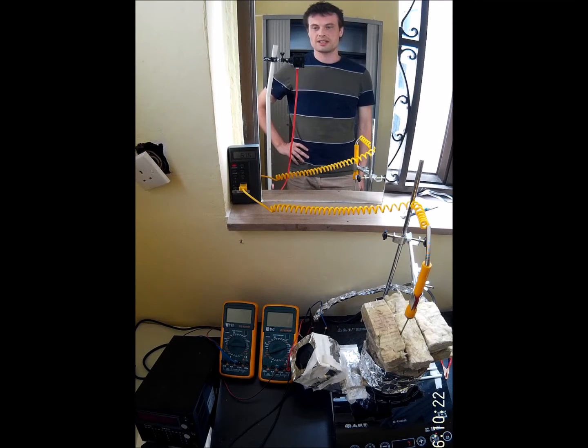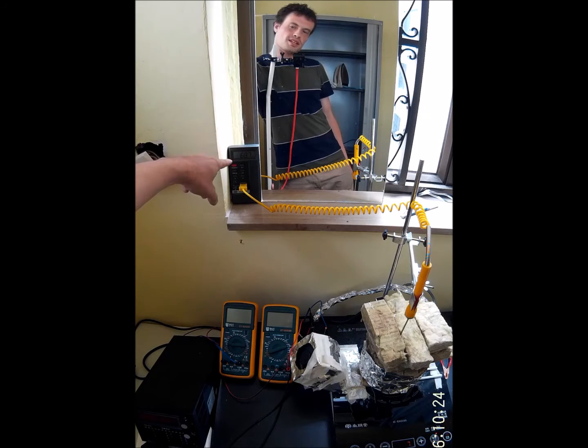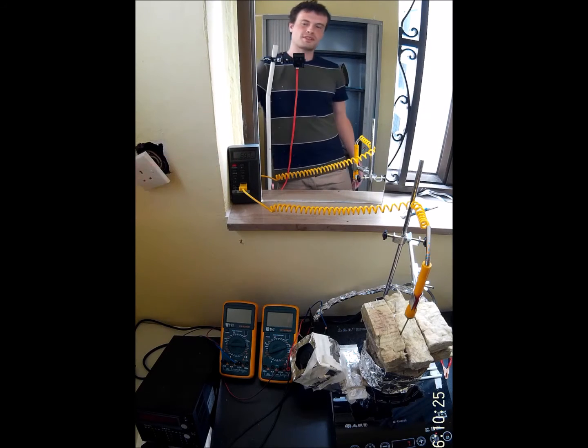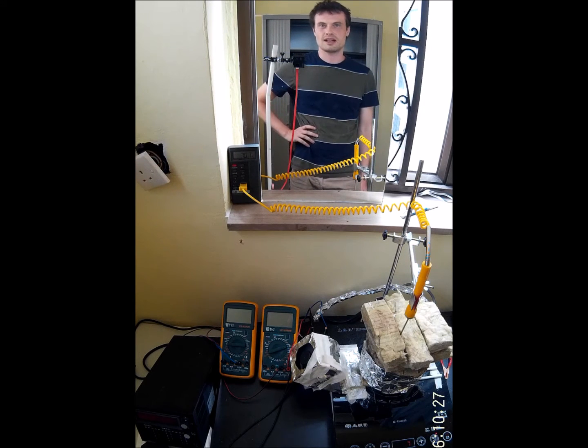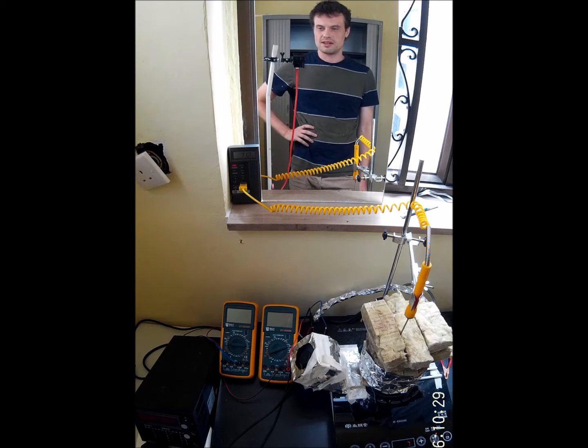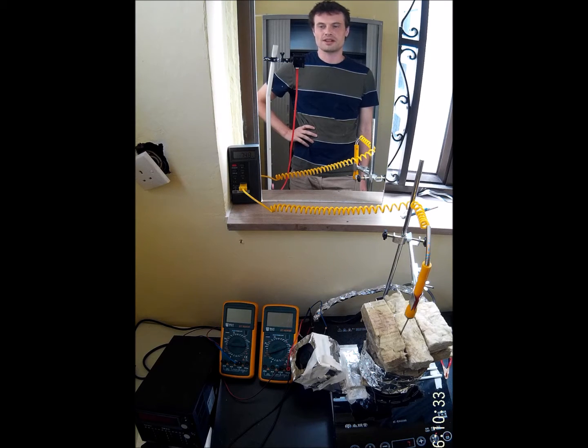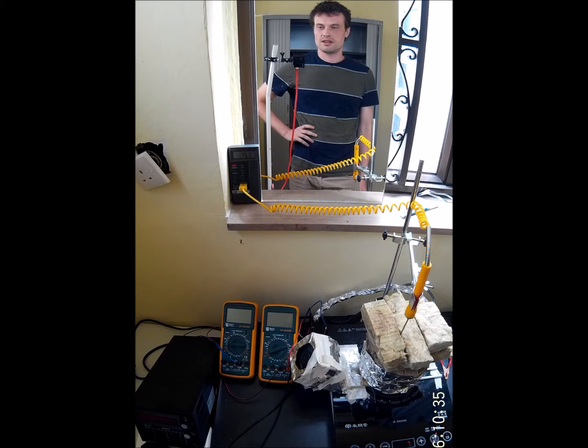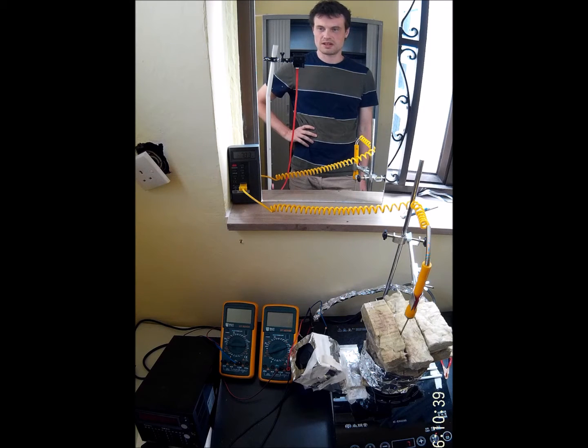So now I'll just watch the thermometer here and I let it rise up to 750 degrees Celsius.